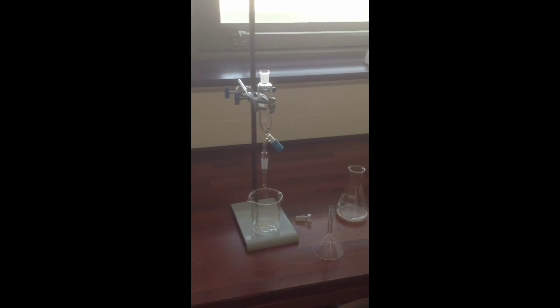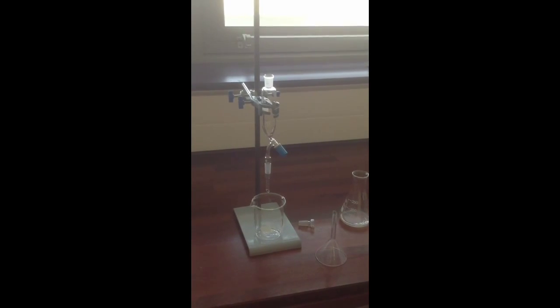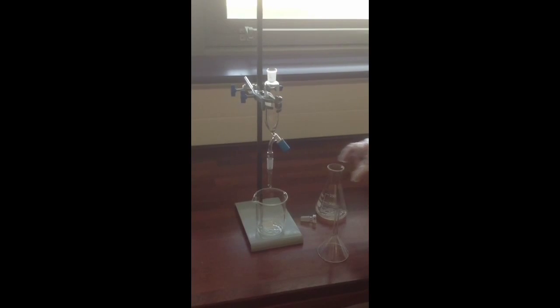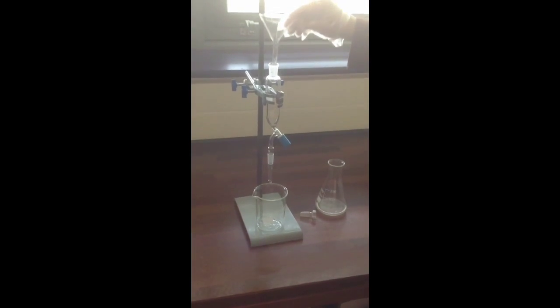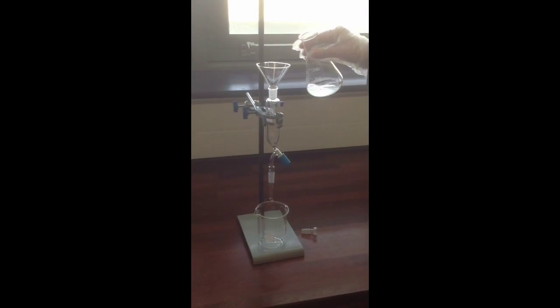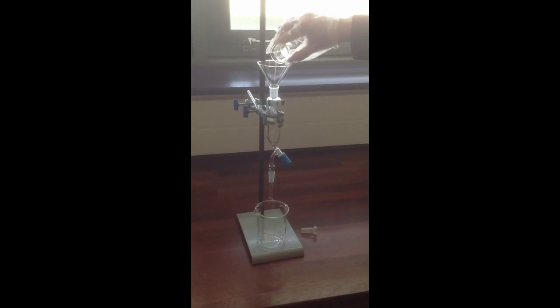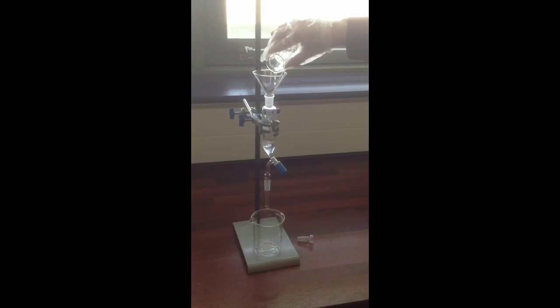After the 15 or 20 minutes reaction time are up, you can take your conical flask over to the clamp separating funnel and transfer in the reaction mixture. To help do this without any spillages, do use a glass funnel, place that in the top of the separating funnel, and then just pour your mixture cautiously in. Of course, the separating funnel tap is closed. We've already talked about that.